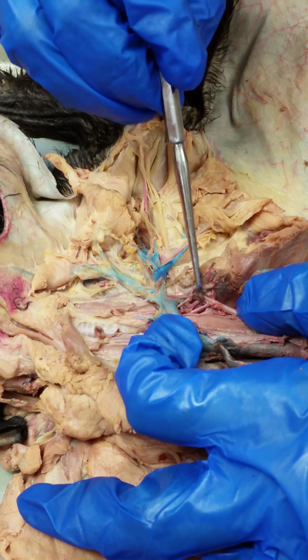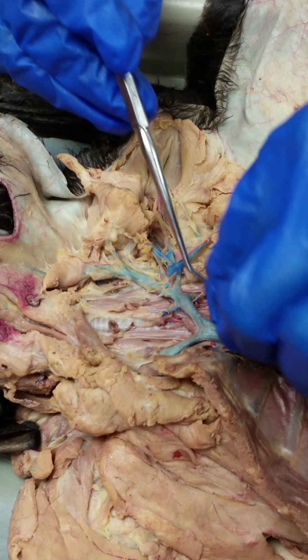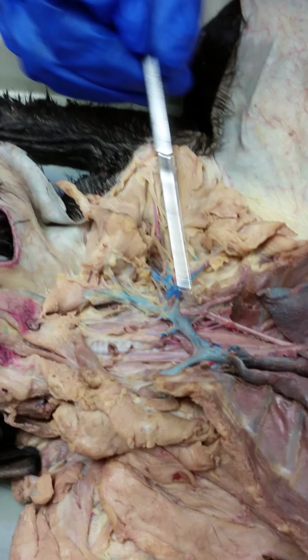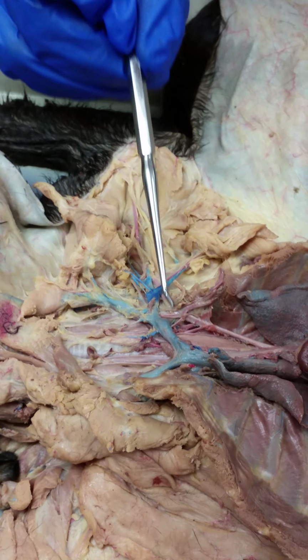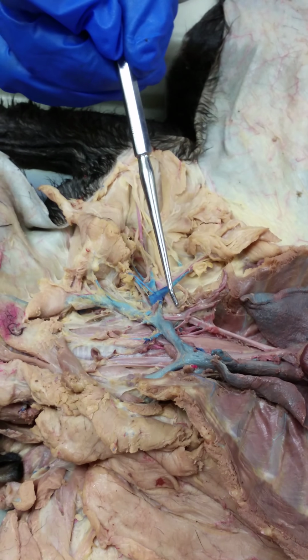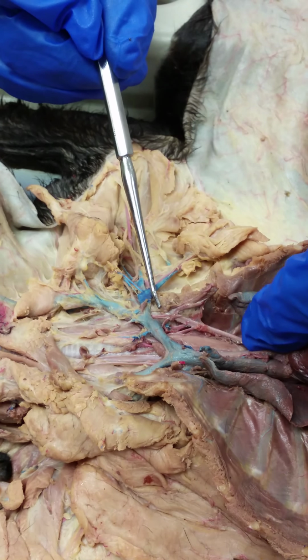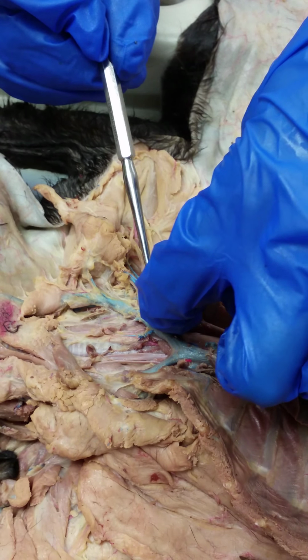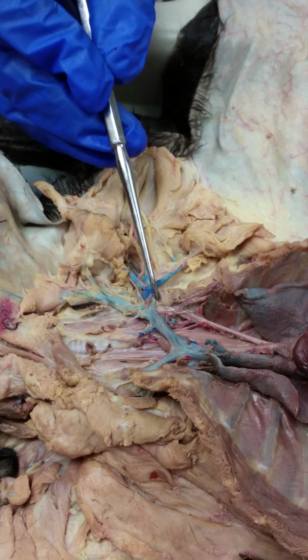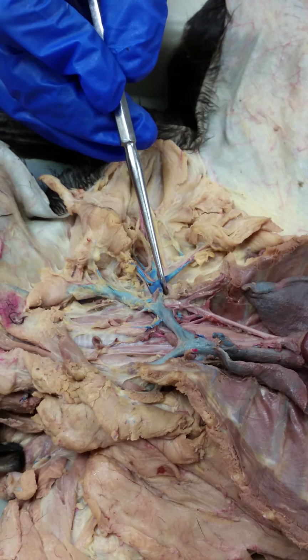The important thing to remember is vertebral, costocervical, thyrocervical, and then your internal mammary is the only one that's coming up ventrally. Okay, then this is our first rib right here. So after the first rib, the left subclavian is now called the axillary. If you remember from the skeletal section, the clavicle is right here in front of the first rib. So that's why this is called subclavian, because it goes underneath the clavicle, subclavian. And then right here, axillary is just another name for armpit. So this is in the axillary region, and it's called the axillary artery here.